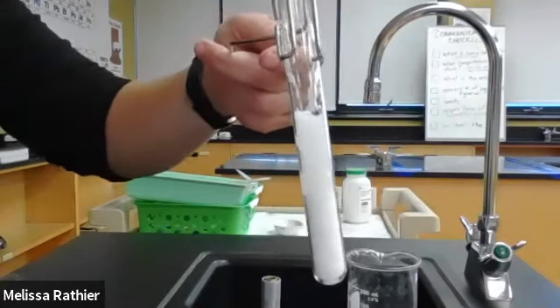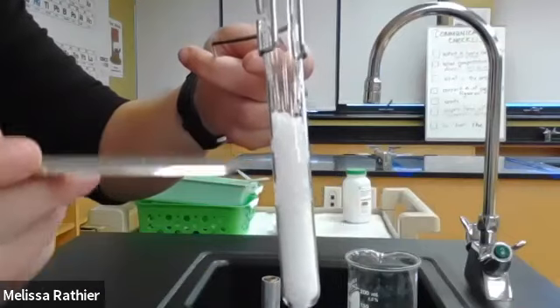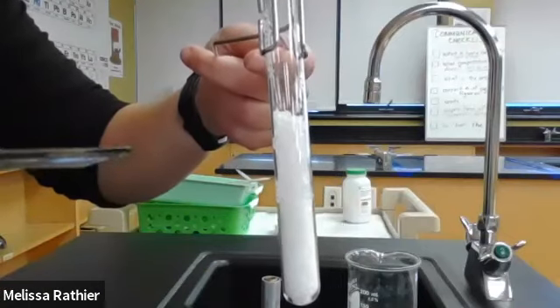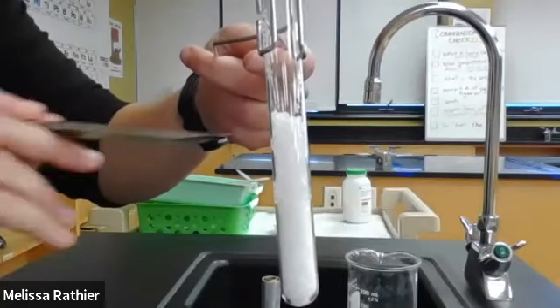It's kind of difficult to see, but that crystal is just sitting on top. Okay, on the other side. Okay, so that crystal just sat there. So this solution that's in here must be saturated, because the additional crystal that I added had no impact. It didn't dissolve. It just didn't disturb the solution that was there.